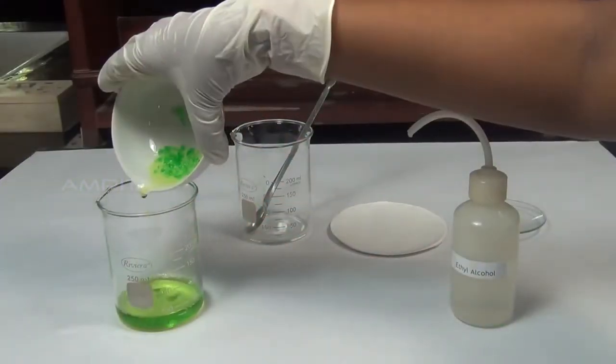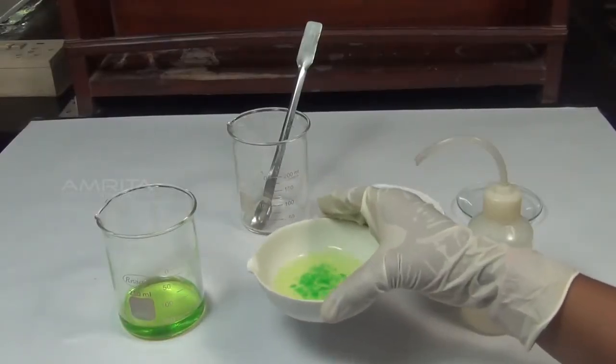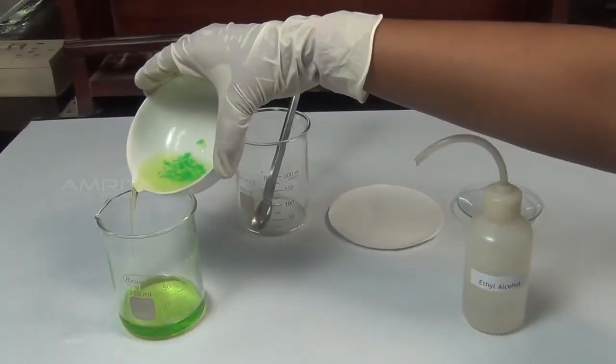Decant the mother liquor carefully into a beaker. Wash the crystals two or three times with small amount of ethyl alcohol.